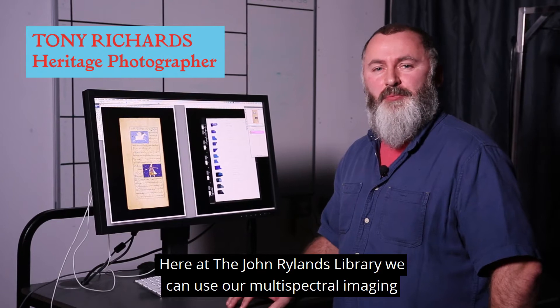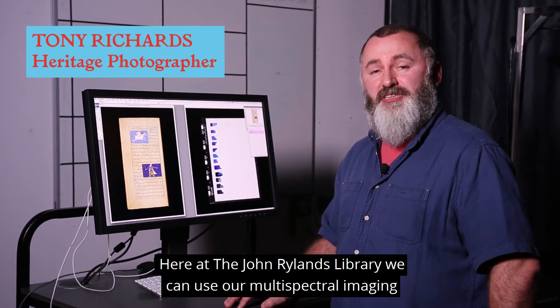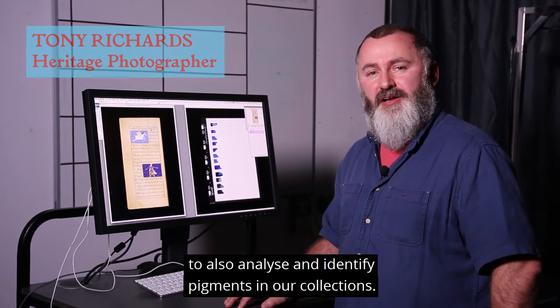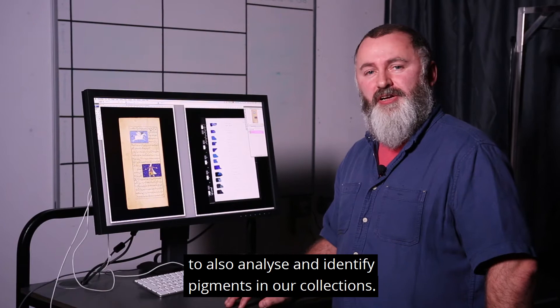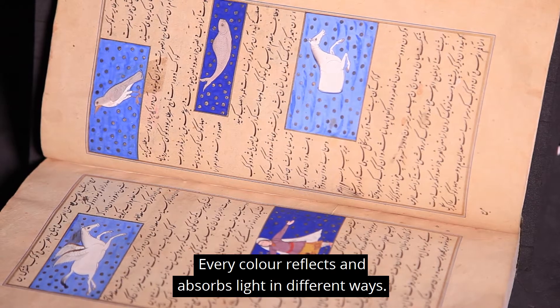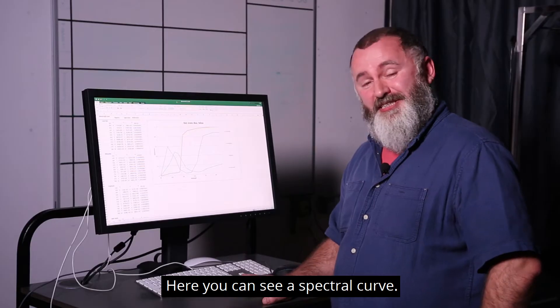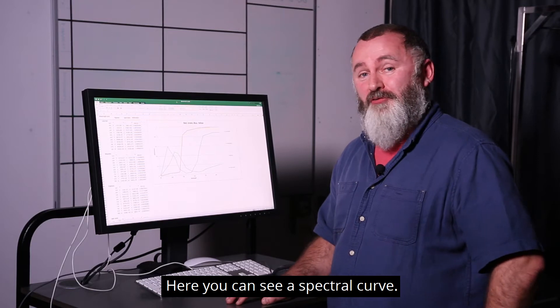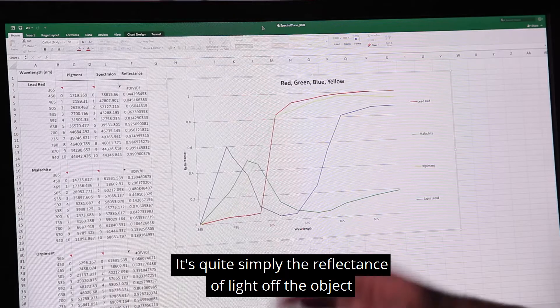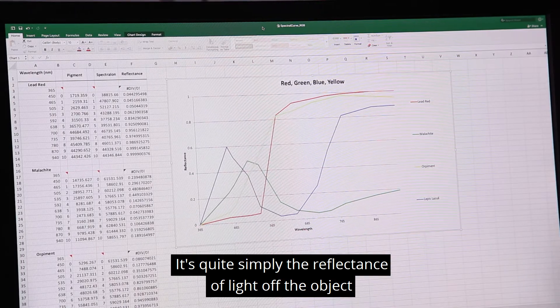Here at the John Rylands Library, we can use our multi-spectral imaging to also analyse and identify pigments in our collections. Every colour reflects and absorbs light in different ways. Here you can see a spectral curve — it's quite simply the reflectance of light off the object.